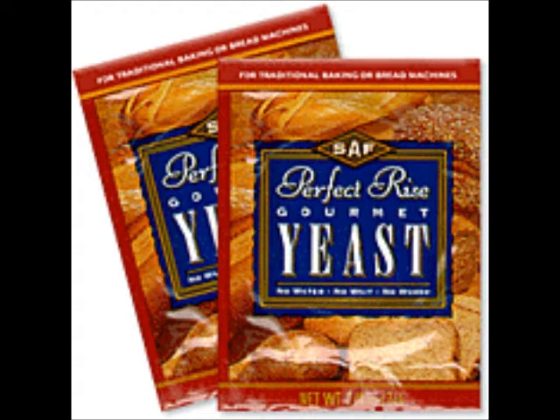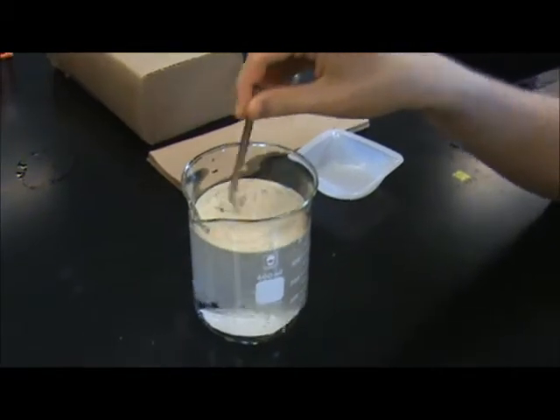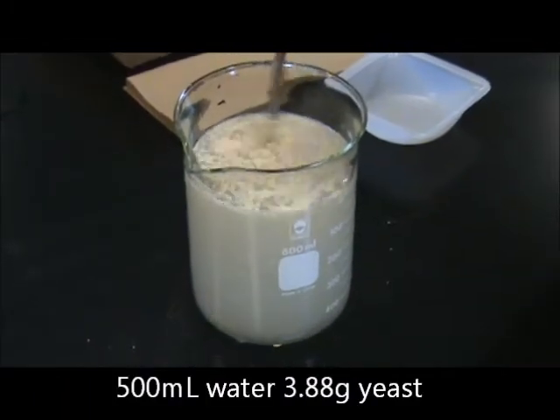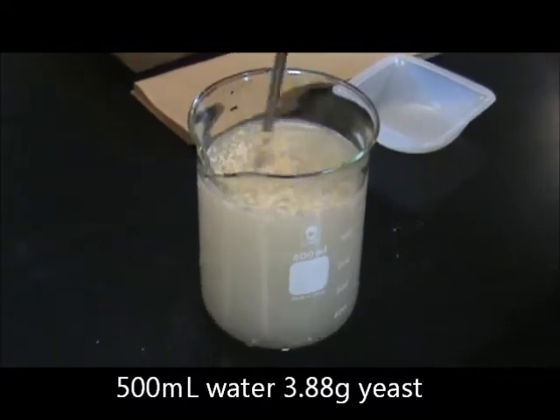The procedure calls for 1 packet of yeast, which is roughly 7 grams, dissolved in 900 milliliters of water. This large quantity was intended for several groups to use at once, and, not possessing the large beaker or the individual packets of yeast required, we had to recalibrate our sample size. Our finished solution held 500 milliliters of water and 3.88 grams of yeast, which was proportional to the original solution, but on a much smaller and more manageable scale.